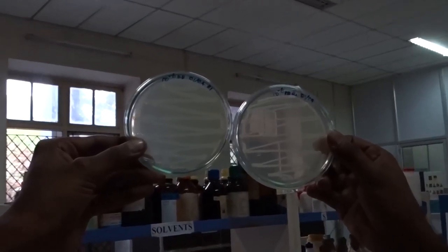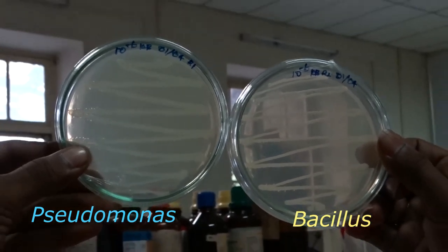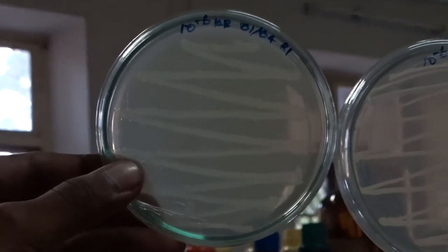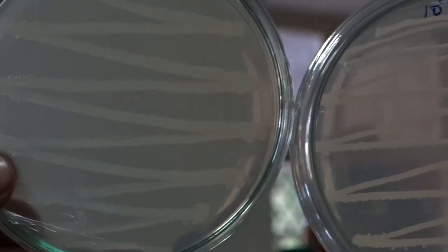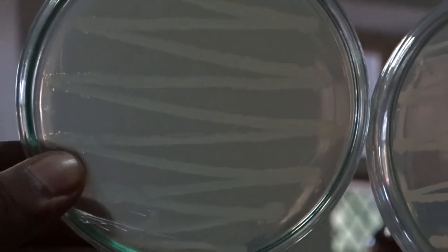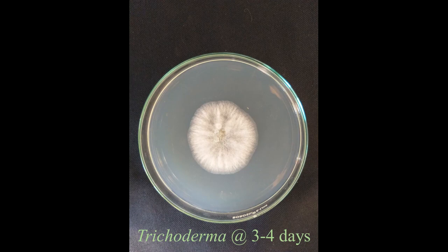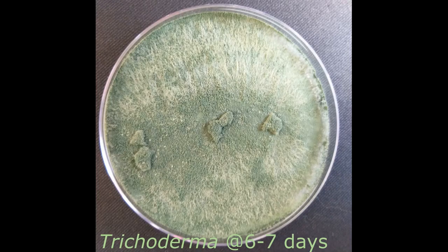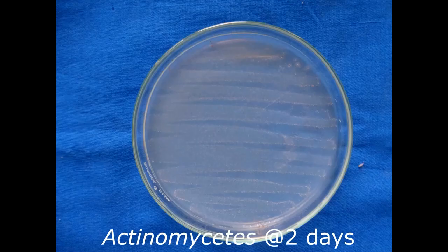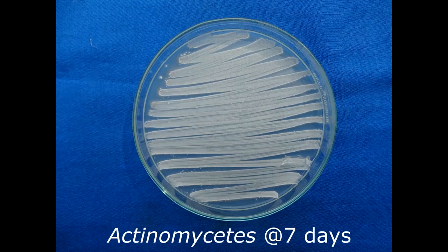Pure colonies of Pseudomonas and Bacillus are observed. Pseudomonas shows fluorescence and Bacillus shows serrate margins. Pure colonies of Trichoderma appear after 3 to 4 days, and after 6 to 7 days. Actinomycetes colonies appear after 2 days and after 7 days.